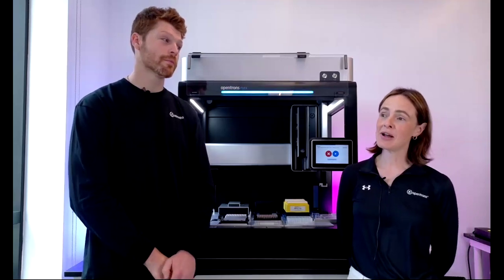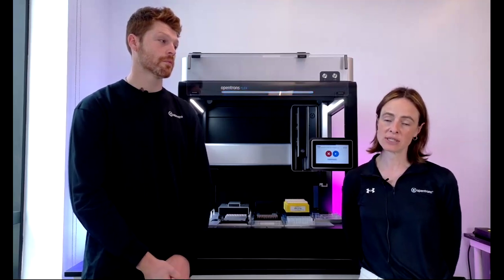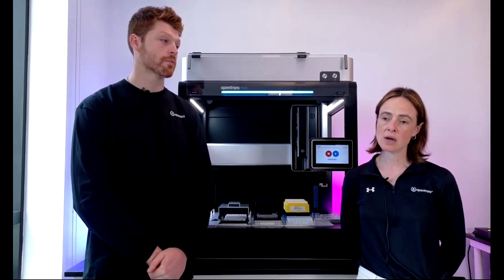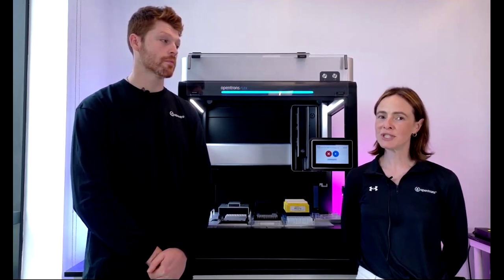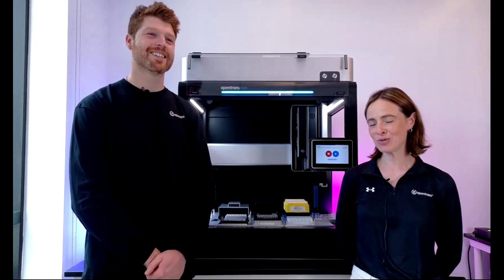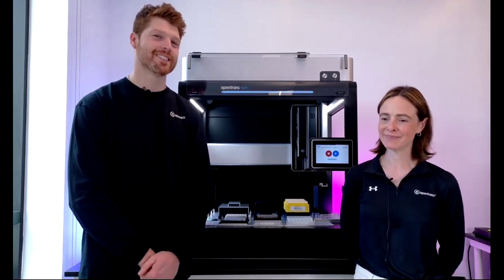All right, William, is there a mechanism to bring plates onto the extension slots from an external source, arm or sliding nest? Well, this is a great question and very timely. Currently, the only option is integrating a robotic arm, like a third-party robotic arm. We do have integration tools for that. But I would say watch this space for some announcements in the near future as to a more embedded solution, let's say. All right, it's a good tease.